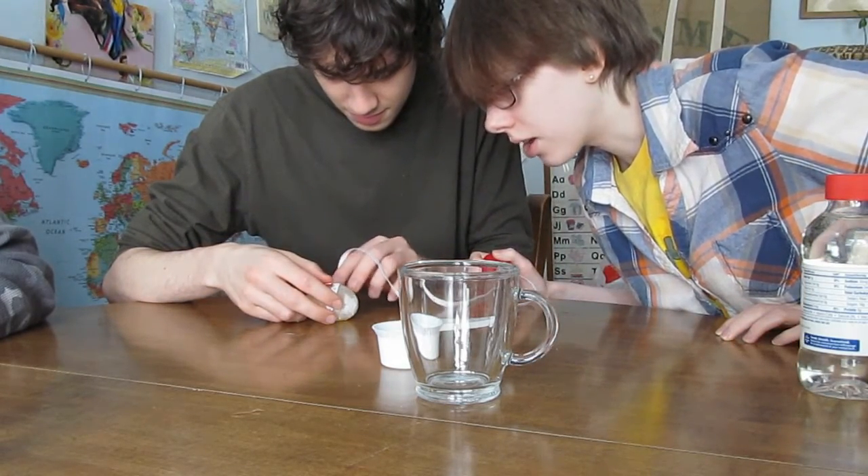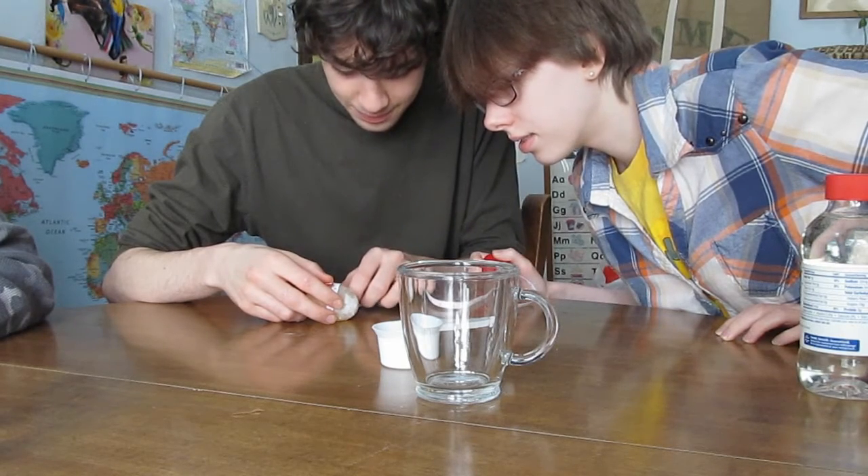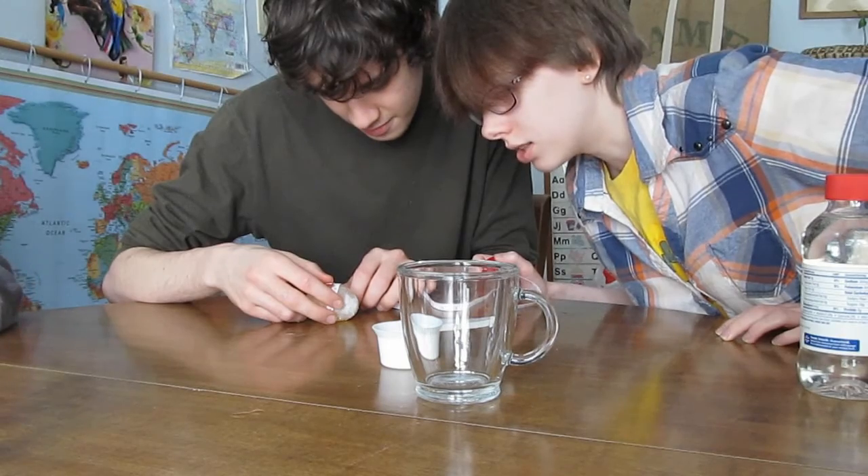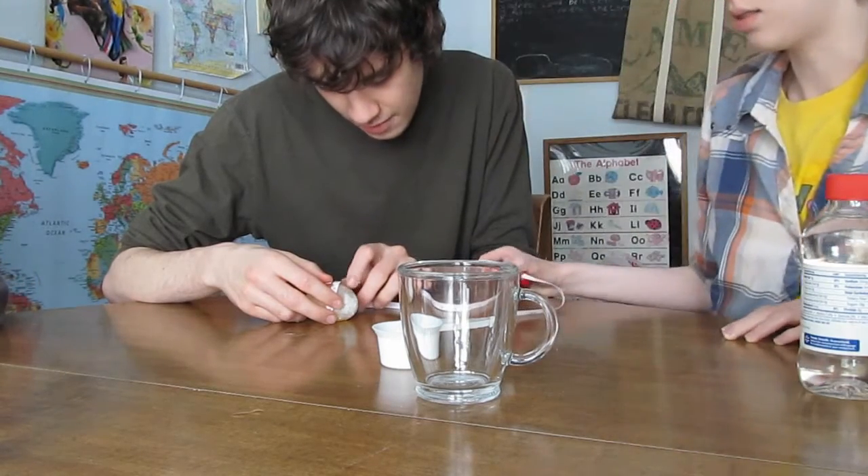It's bigger, it's bigger Mama! Now it's five and three-fourths. And how big was it before? Five and one-fourths.